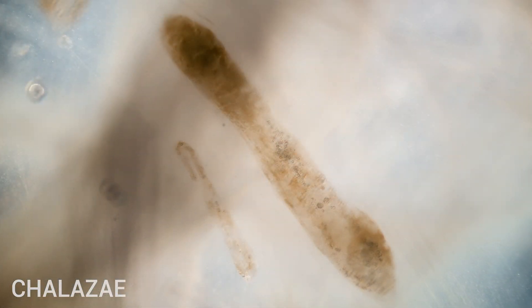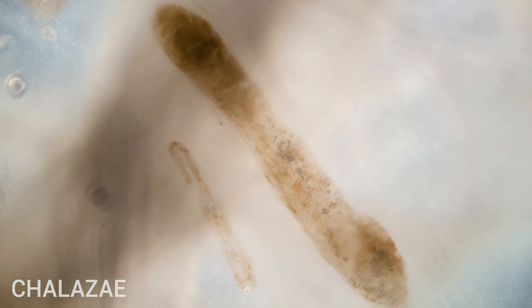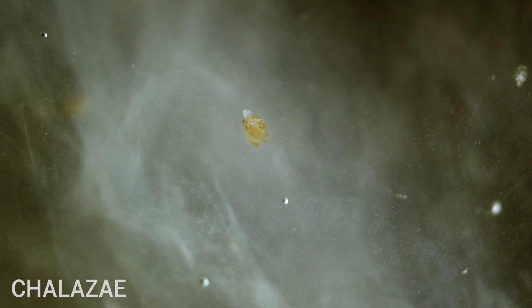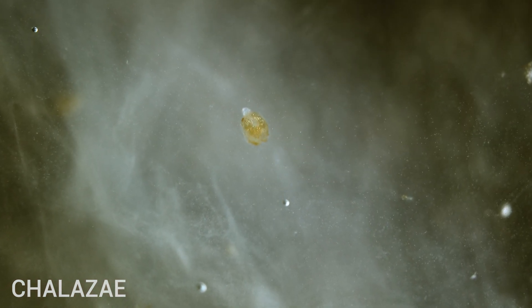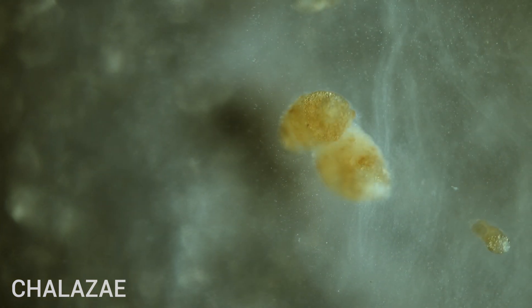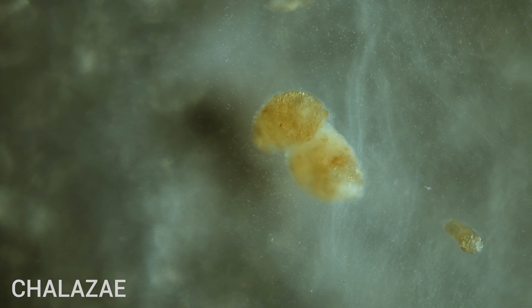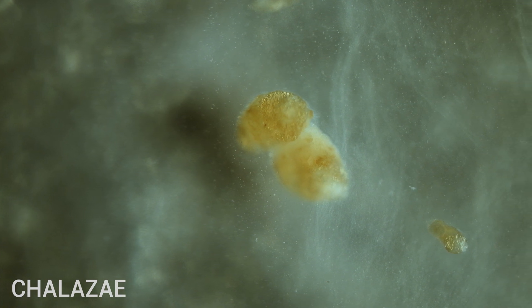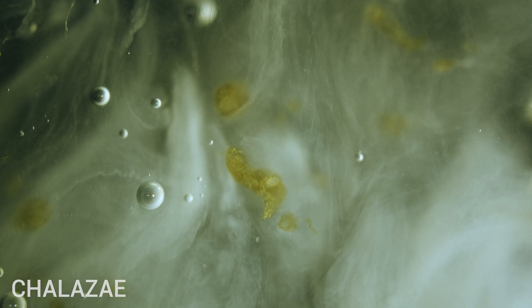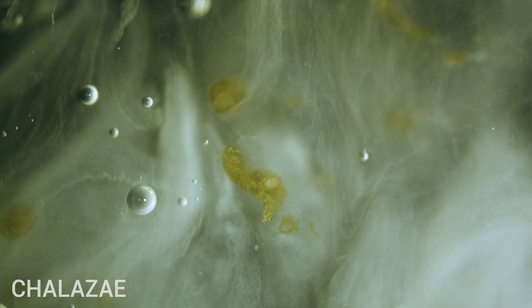While watching this part of the video, you'll notice orange-looking particles suspended in strange cocoons. There are also visible calcium crystals inside them. The red color could be linked to traces of blood present. However, I wasn't able to confirm it, as there are no red blood cells present — they possibly dissolved, leaving partial hemoglobin behind.